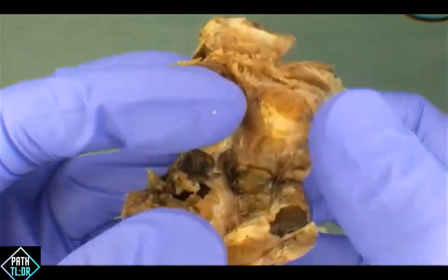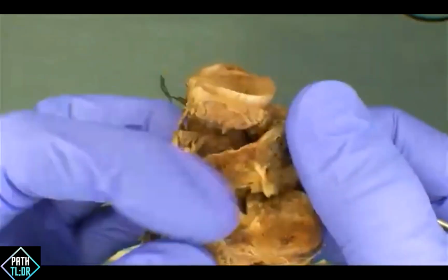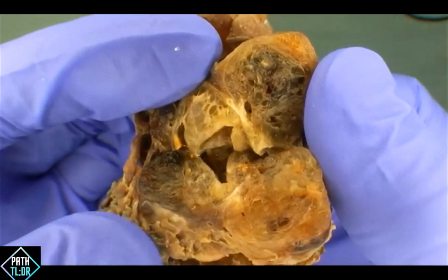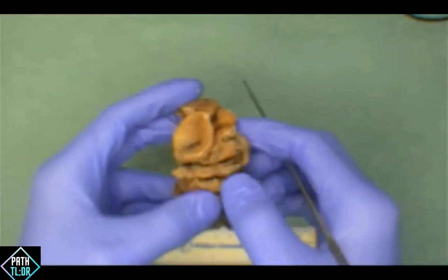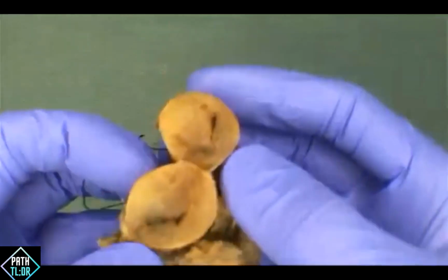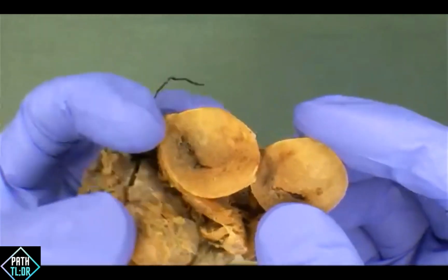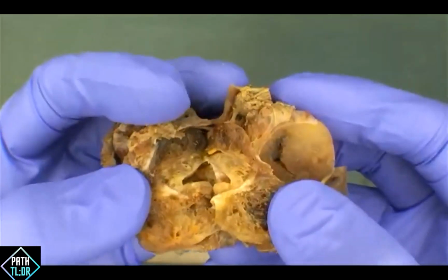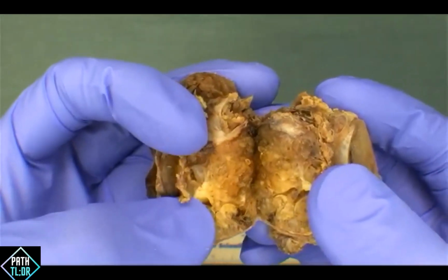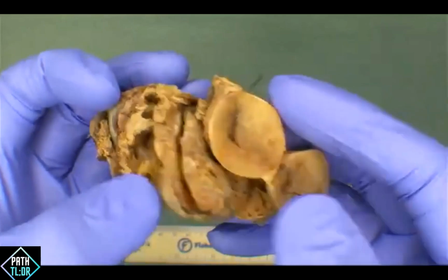Okay. So based on what we're looking at, what do folks favor in terms of what these nodules are? Okay. Follicular nodular disease, MNG, so multinodular goiter, yeah. Anything else? Between the two that have been presented, what do folks favor more over the other? There we go. So this is looking at the cut surfaces, and given how multinodular it is, I think some keen eyes noticed some of these more gelatinous and colloid-rich areas. This is indeed an example of multinodular goiter. The key features are the fact that there's some calcium here and that there are focal areas that are more calcified, but you can see the heterogeneity from nodule to nodule.